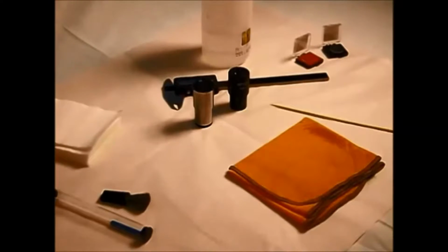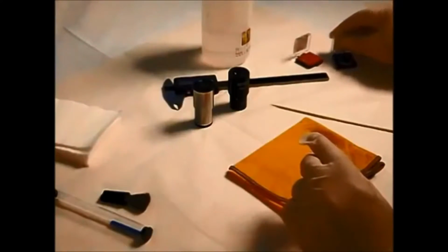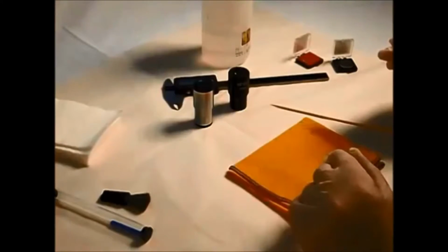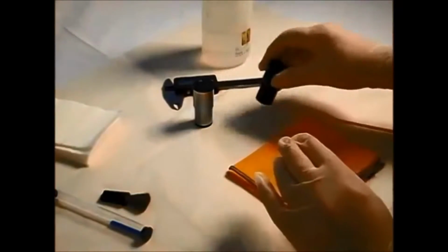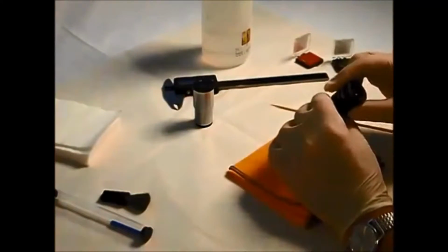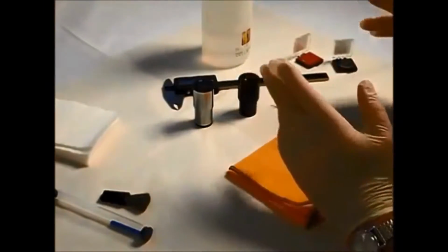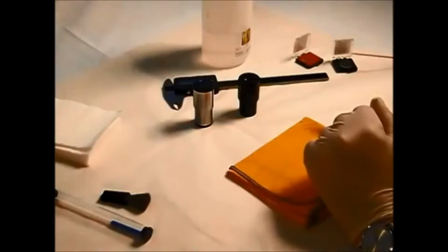We're going to fit some reticules into the 2 eyepieces we have here. The most important thing when doing this job is keeping the new reticule and the eyepiece assembly clean and free from dust, dirt, fingerprints. It's very important. There's nothing more distracting than a small piece of contamination obscuring the view, especially when you know you're the one that put it there. The lines on the reticule are 15 microns in thickness.